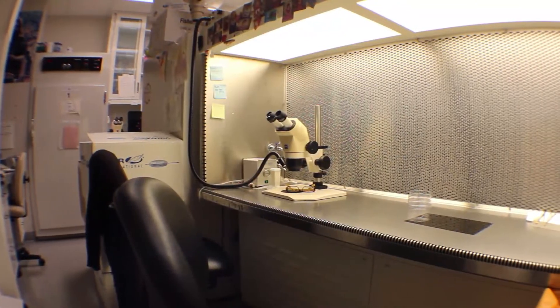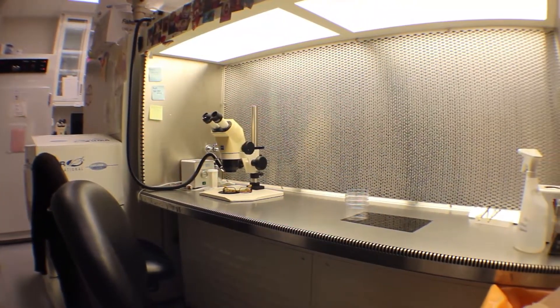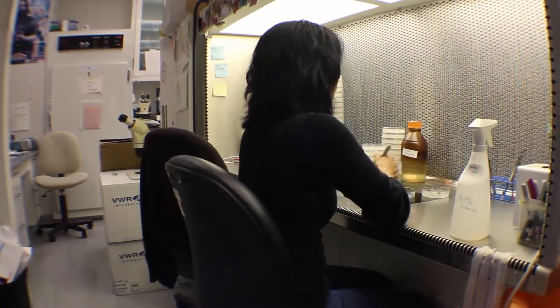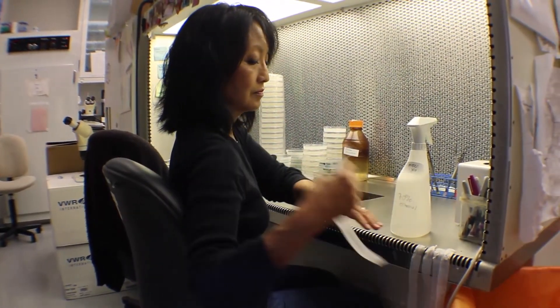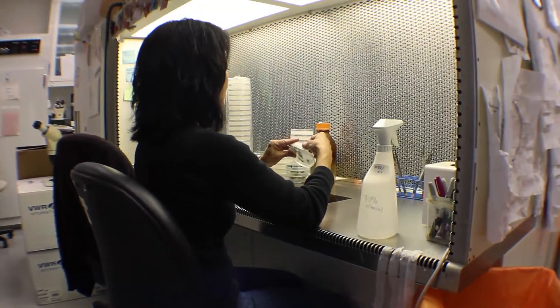This big apparatus here is called a hood. What this hood does is it pulls the air through a HEPA filter and blows it out towards me, creating a sterile environment in which to work.